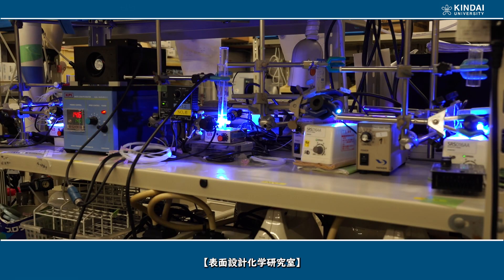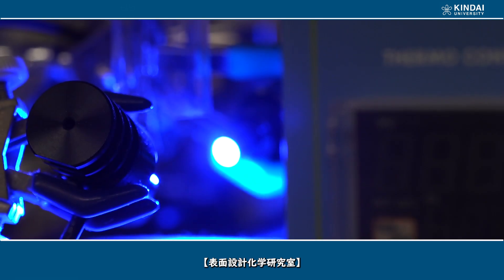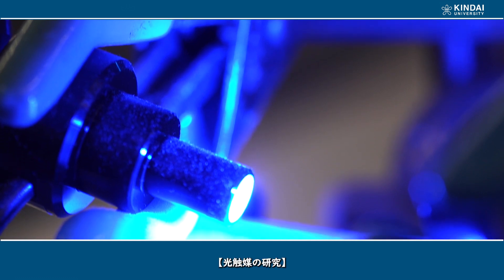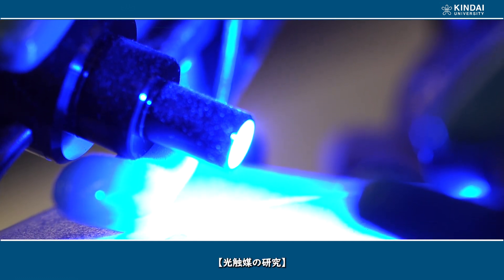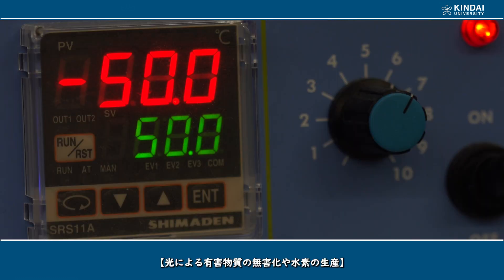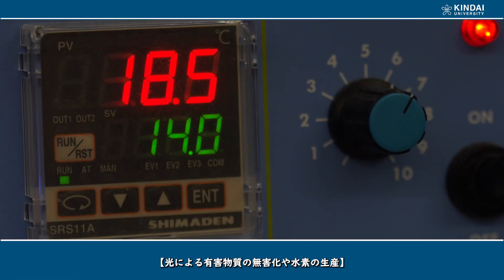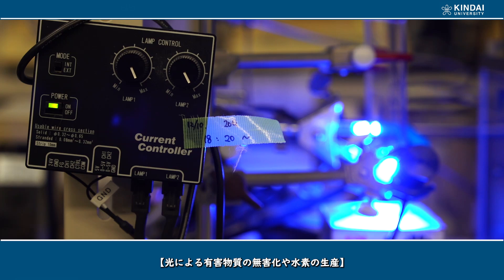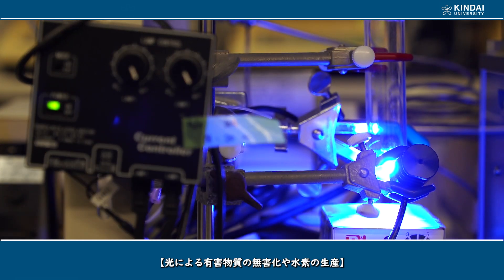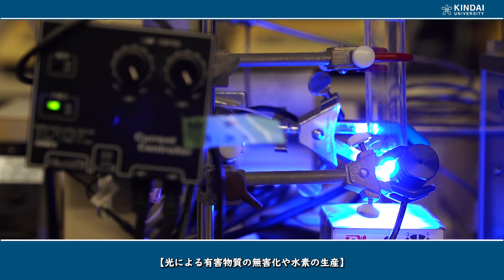This is the Laboratory of Surface Design Chemistry, where research on photocatalysts is conducted — including detoxification of toxic substances and production of hydrogen by light.